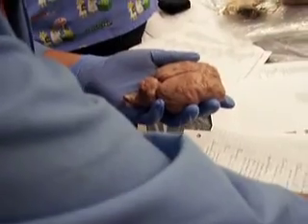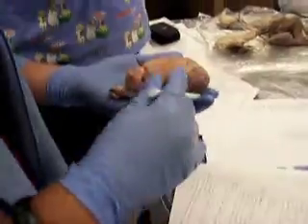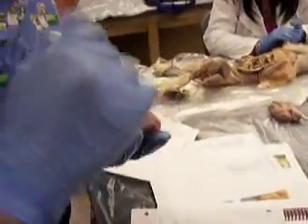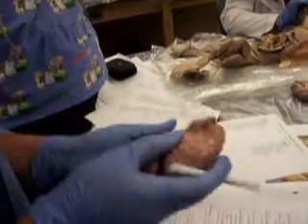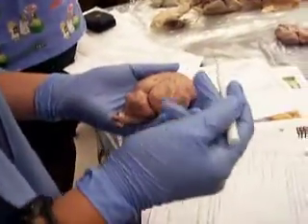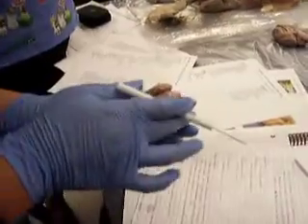Alright, so sulci, gyri, and then the cortex and the medulla, it's actually backwards. The medulla is the white matter, and the cortex is the gray matter. So think of it, the medulla is an M, you flip it upside down, it's a W, white matter. And then the cortex is the C, the G kind of curves like a C, so you can associate those two letters. The cortex is the gray matter, so it'll be more on the outside. When I cut it open, you'll see the difference.